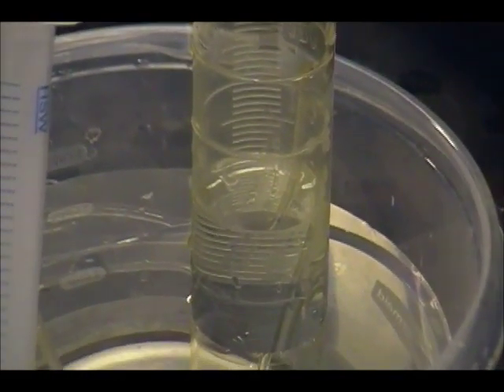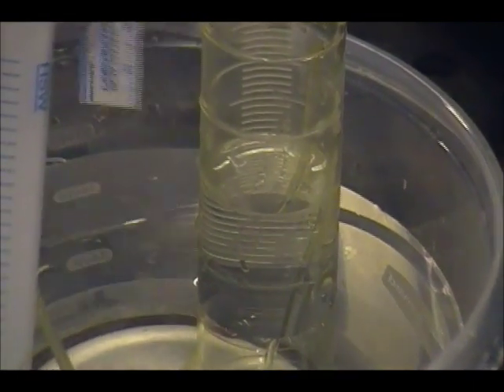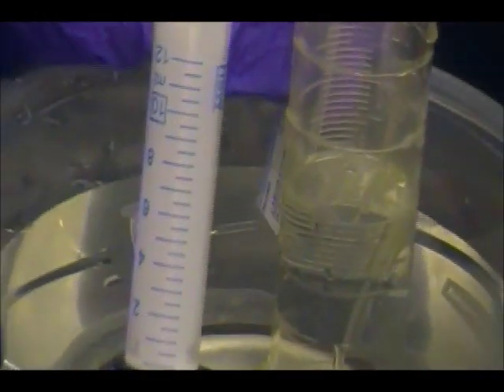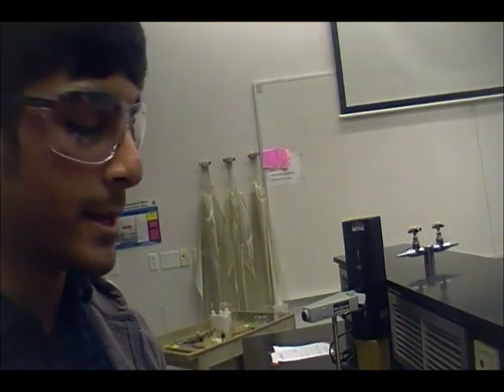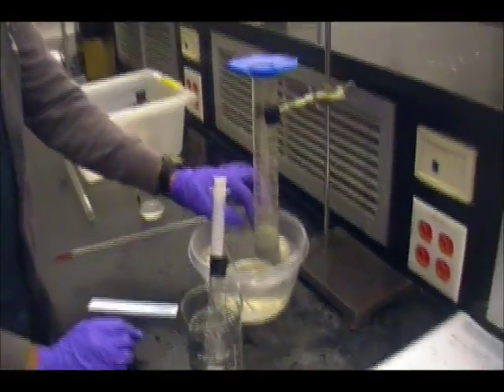So to calculate the difference between the barometric pressure and the hydrogen gas's pressure, we have to use a ruler to calculate the difference in centimeters from the water level of the container and the water level of the graduated cylinder. So when your TA gives you the barometric pressure in torr, you'll need to subtract your measured difference for your pressure value, and that'll be subtracted from the barometric value because the hydrogen gas's pressure is less than the barometric pressure.